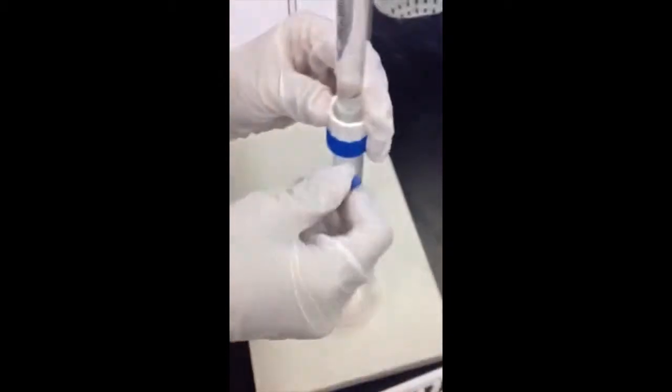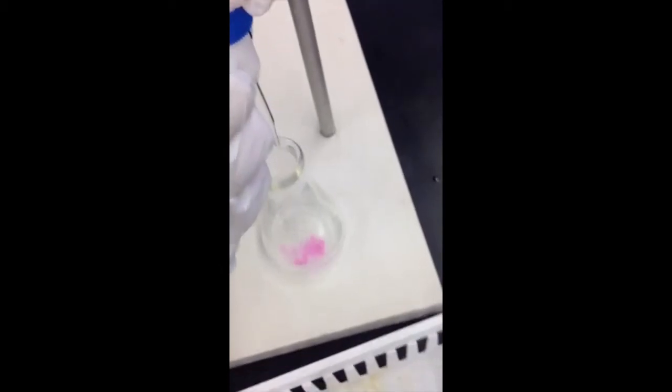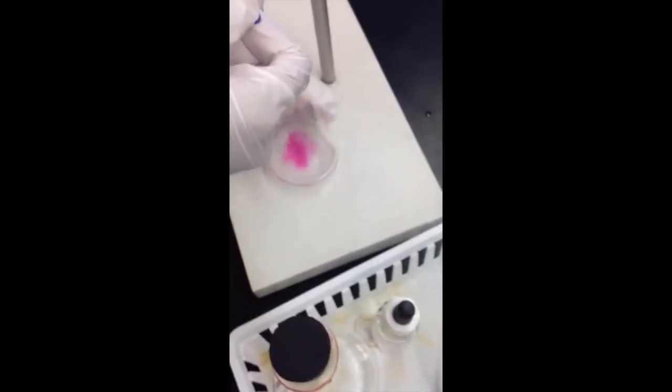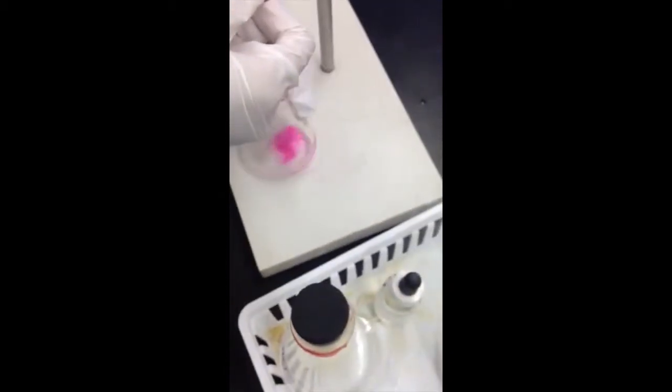Slowly, some base was released from the burette into the Erlenmeyer flask while constantly swirling. The pink color of the indicator faded with swirling. More base was added until eventually the equivalence point was reached and a light pink color remained after swirling for 30 seconds. Then the initial volume was subtracted from the final volume, giving the exact volume of base released into the flask, and this value was recorded to the nearest 100th milliliter.